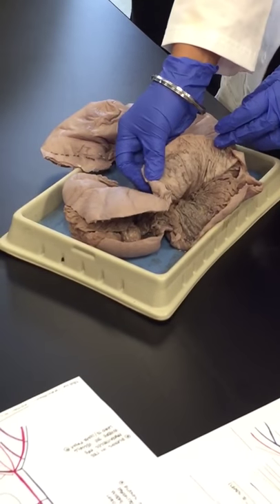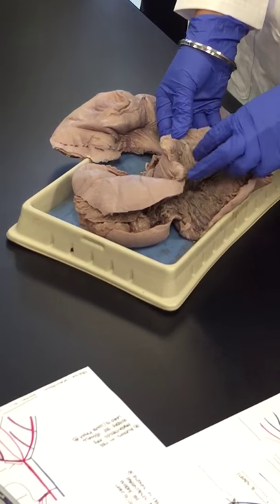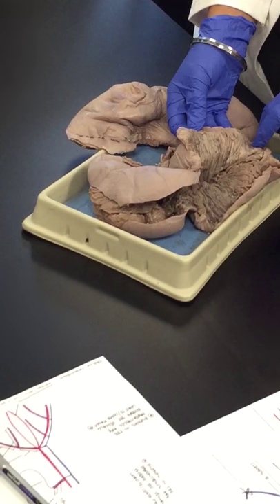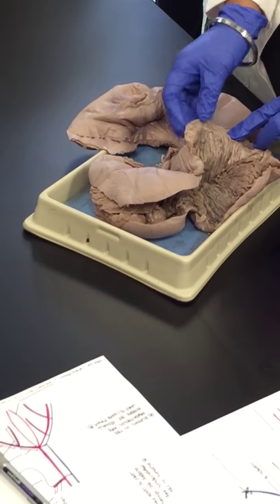If I open it up and look inside, this very thin covering on the inside is called the allantois.